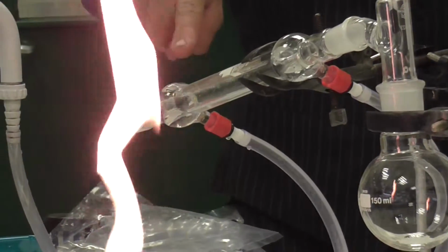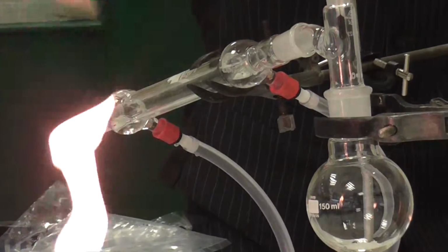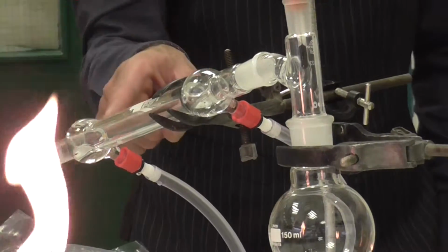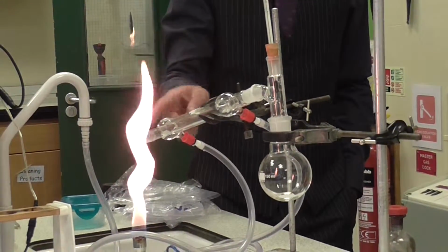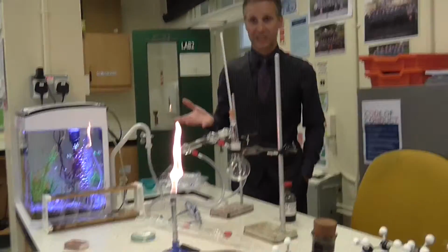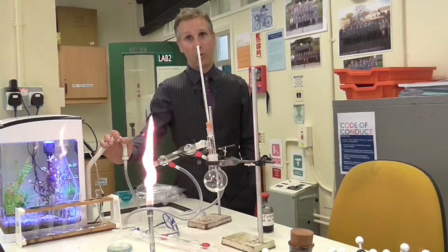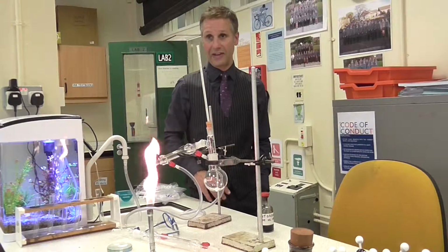It's very important to run it from the bottom because you want the coldest part of the apparatus to be here, so that any vapours, if we were boiling alcohol at 78 and it passed through this tube, it's hitting water that's at room temperature, about 20 degrees, and it will condense back into a liquid, and we can collect it out of the end in a test tube. So we would be able to distill off the alcohol very easily. Now this method is used in making strong alcoholic drinks. So if you wanted, for example, to distill wine to make port, you could do that by boiling off some of the alcohol, and you'd end up with a stronger solution of alcohol at this end.